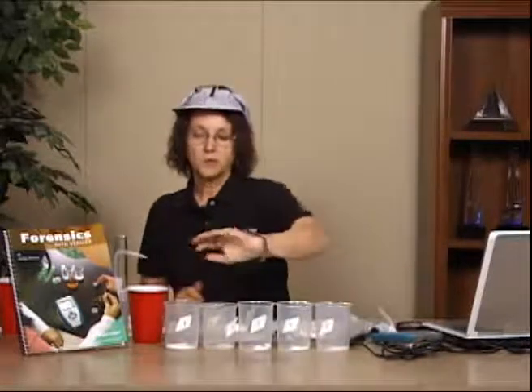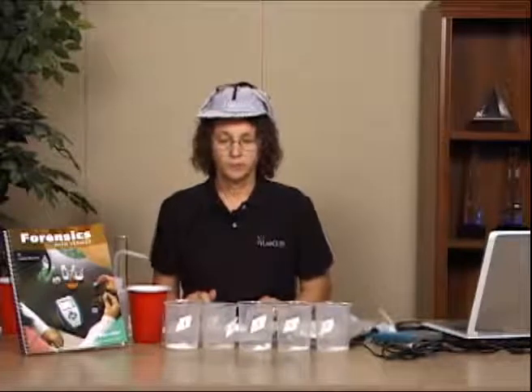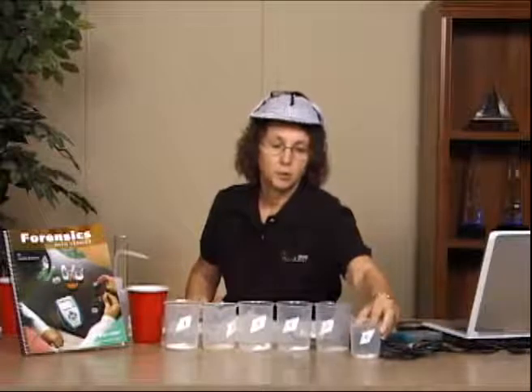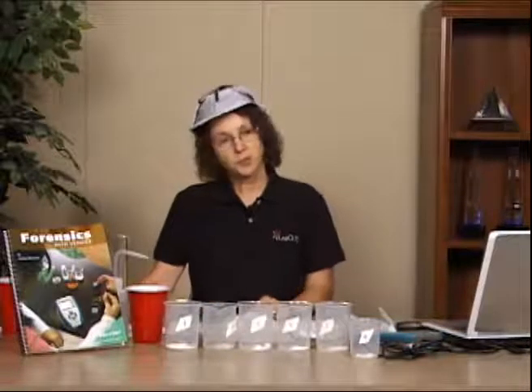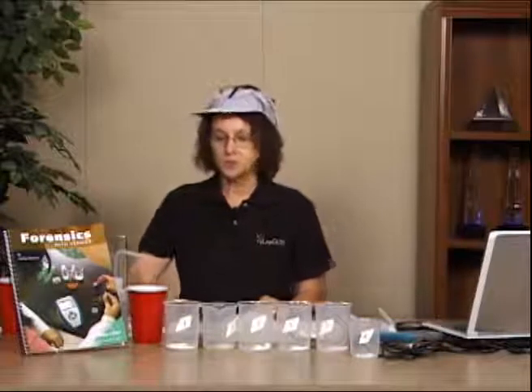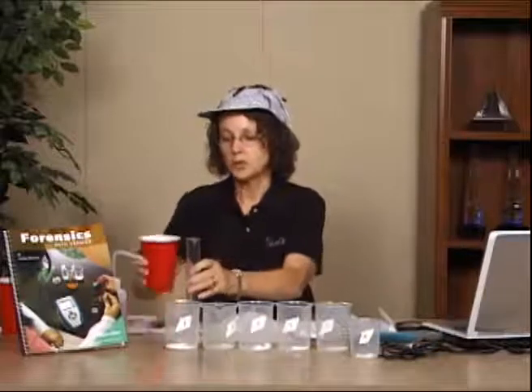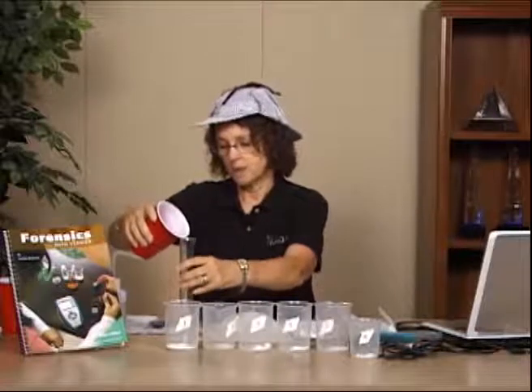And what we've done is we've taken and we've weighed out samples, and we've put them into 5 beakers, 1 through 5, and then we've taken some of our mystery unknown and we've put it in beaker letter X. And if you follow the instructions, the first thing that you're going to have to do is have the students weigh out the white powder, and then have them take 50 milliliters of water and pour it into each of the beakers. And so we're going to just do some of that now.